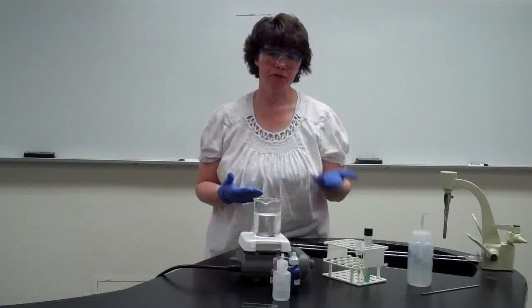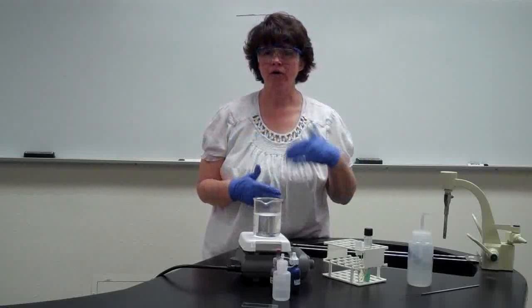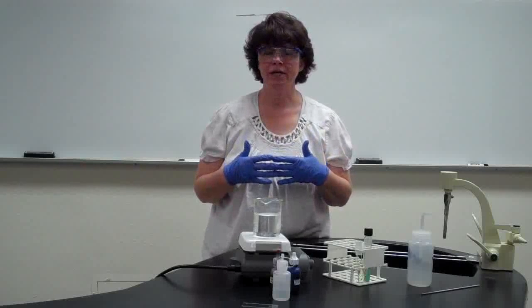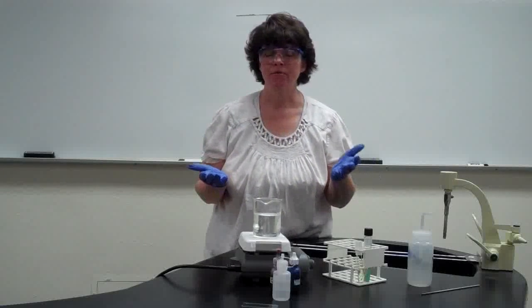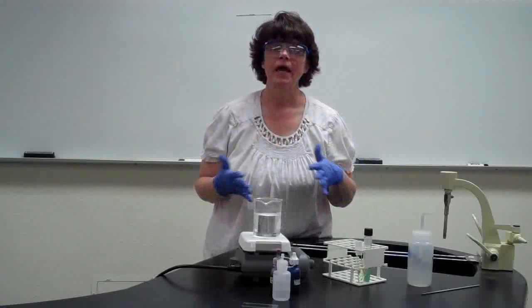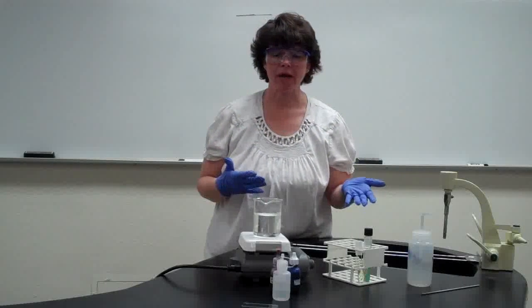The other thing about the fact that that mycolic acid is there is if you use something like the gram stain where you put on the crystal violet and then rinse it and then use the ethyl alcohol to decolorize, that purple stain will never penetrate through the waxy mycolic acid. Therefore, it would never gram stain purple even though it is gram positive. And these are gram positive even though they won't stain that way.